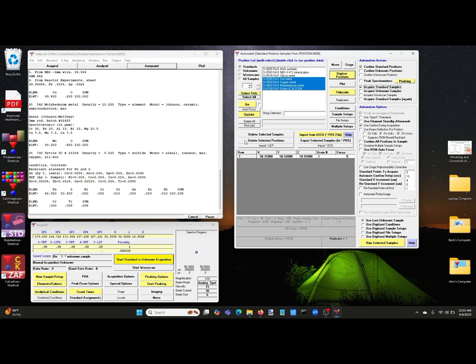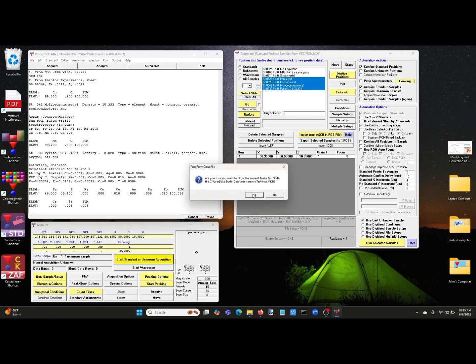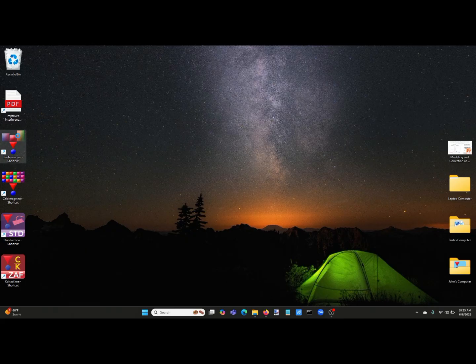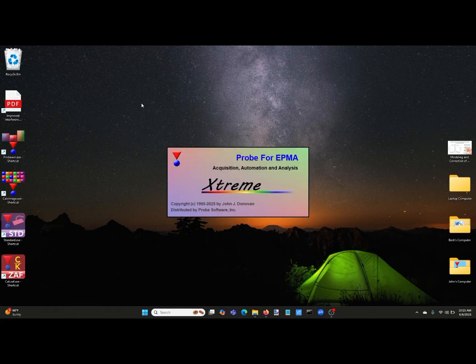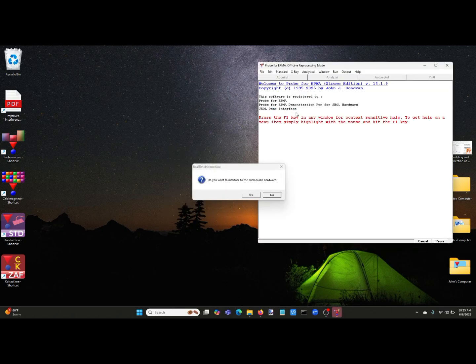And of course, we've already assumed that we've peaked up the elements, each of these elements, run wave scans to check for background interferences, and also adjusted our PHAs. So once we're all done acquiring that data, then we can go ahead and assign the standards. And I will open up a run in which we've already acquired the data to show this. Although you can acquire it in demo mode in Probe EPMA, although the resolution of the virtual microprobe in Probe EPMA is somewhat better than the real world.